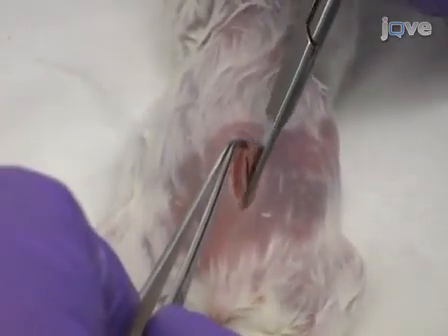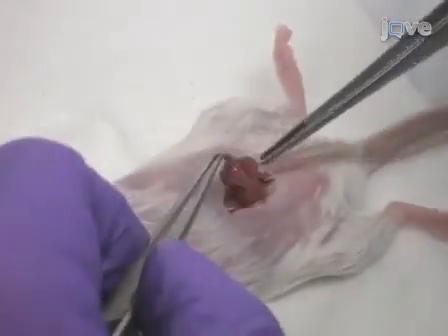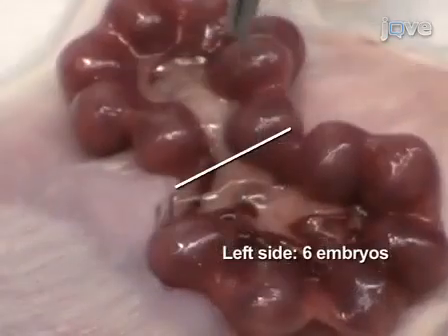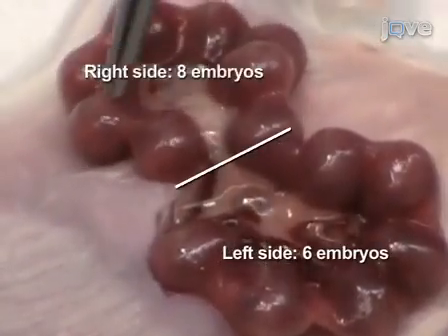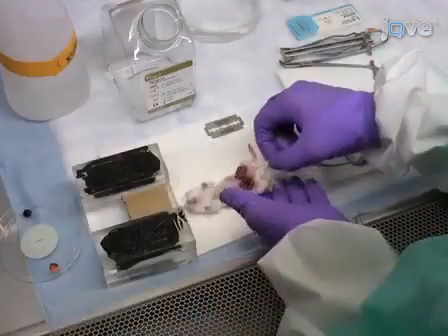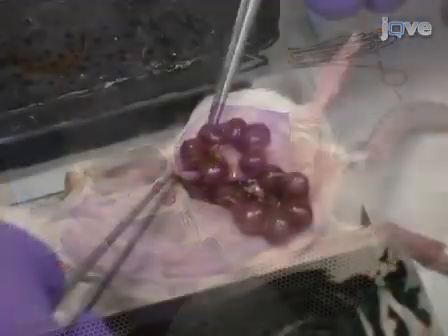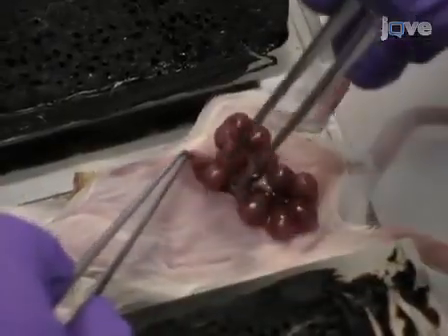Next, make a slightly shorter incision through the abdominal muscle. With forceps, gently draw out the uterine horns. Record the number of embryos on each side. Transfer the animal to the plexiglass injection stage.